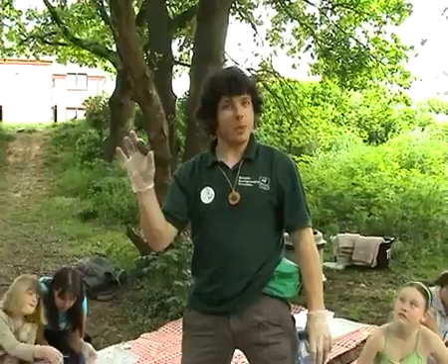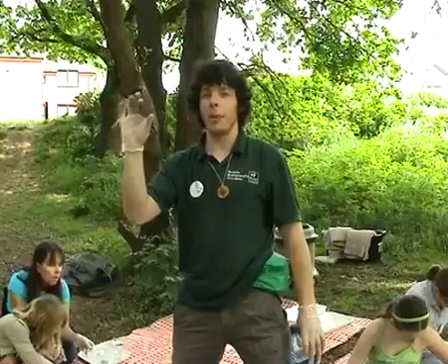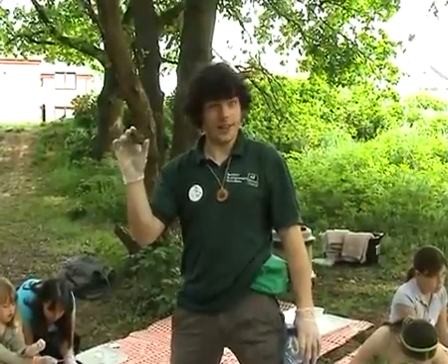This is a barn owl pellet and what we're doing today is dissecting them. They're dried out so we have to make them moist and dissect them. Basically, it's the remains of small mammals that owls eat — what's in there is hair and bones, and we're actually trying to discover what the owls had for dinner by the bones that are in there.